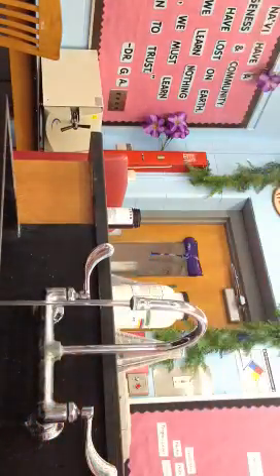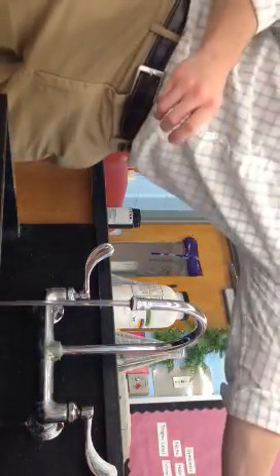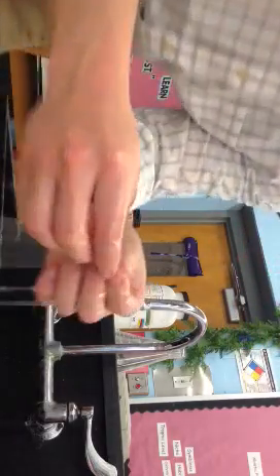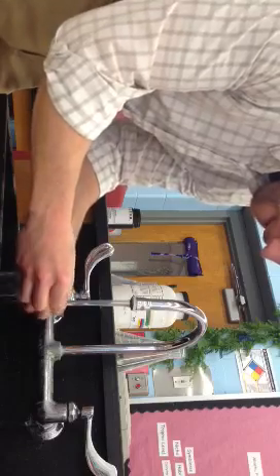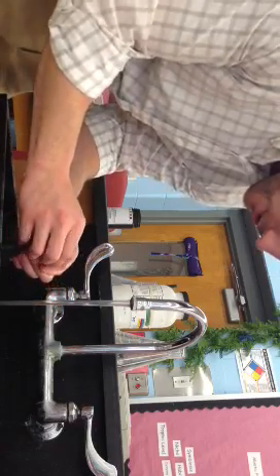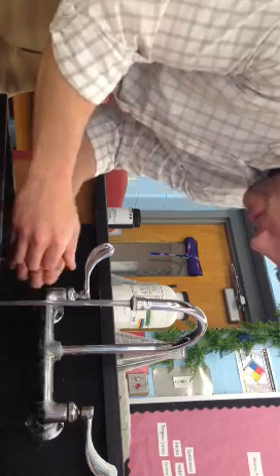We're going to take it out, we're going to rub back and forth while it's under the water, and eventually, towards the edges usually, it will separate.